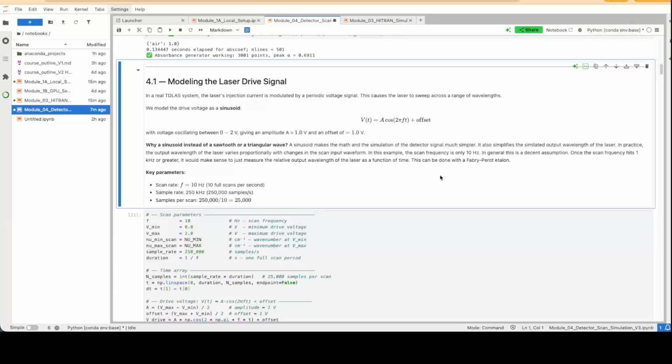So there's the simulation of the drive signal, which is essentially the injection current to the laser. That part's not too complicated. We're just choosing a sinusoidal function. I talk a little bit about it here. In practice, you can use a triangular or sawtooth waveform for this kind of sensor. That can be simulated too. I just went with a sinusoid because the math is simpler, and in terms of how we estimate the output wavelength of the laser, it's a lot simpler, but it's something that could definitely be done if it's sawtooth, for example.